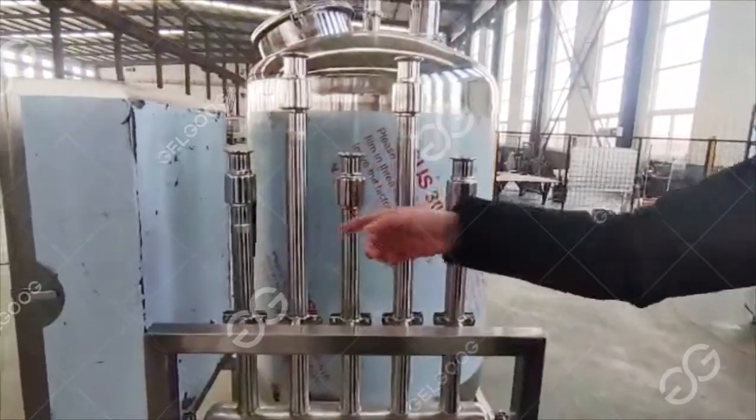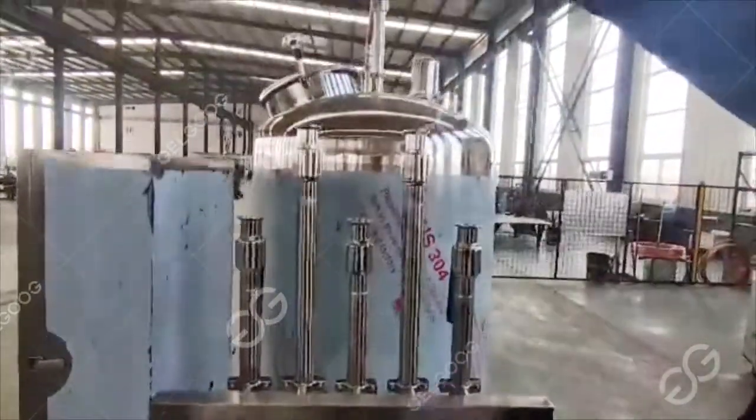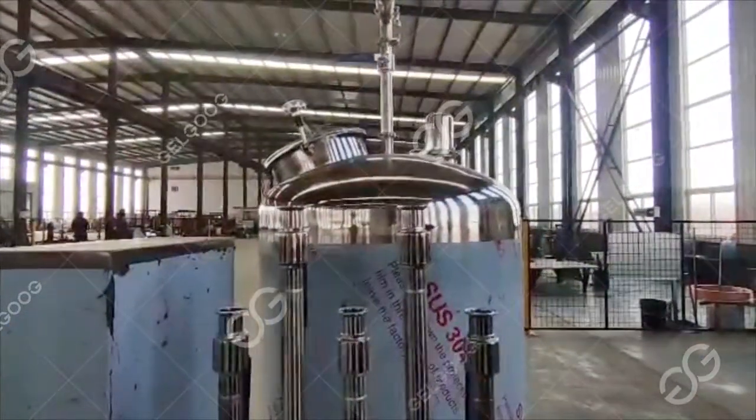It undergoes a cleaning. After cleaning, we can close this valve, then turn off our centrifugal pump, and turn on our return pump. The return pump can recover our cleaning fluid. It enters through the above pipeline, opens the corresponding valve, and enters the corresponding tank.